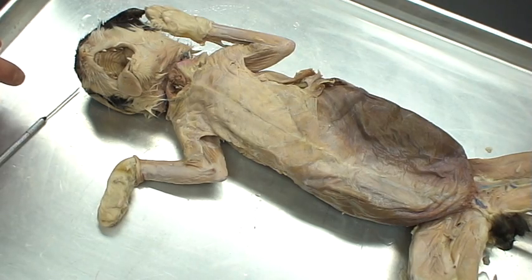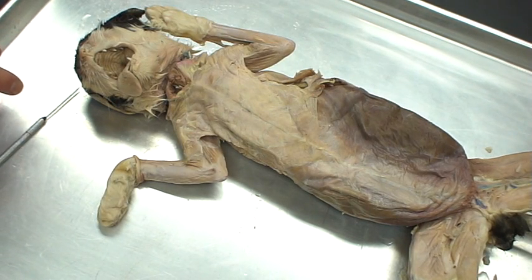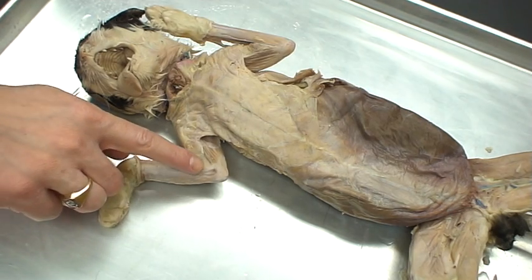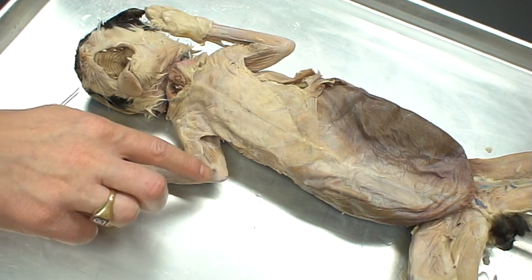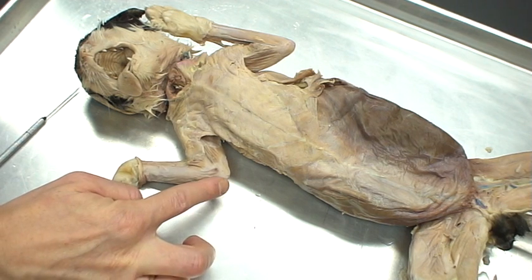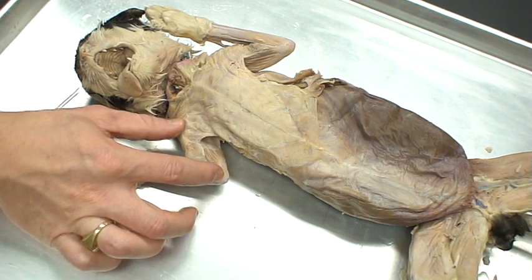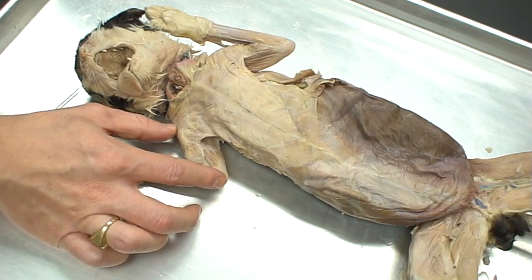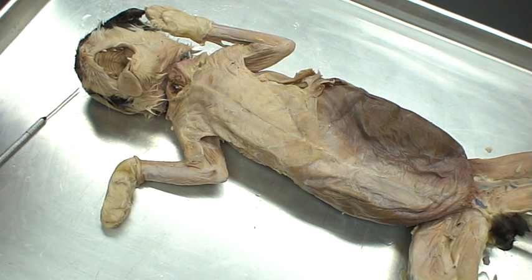There are better terms for that. We'll use cranial, meaning toward the head, and caudal, meaning toward the tail. When we talk about proximal versus distal, proximal means toward the attachment point to the body itself. So if we look at the radius and ulna here, this would be the proximal point and this would be the distal point. If we look at the humerus, up at the shoulder would be the proximal attachment and here would be the distal part of the humerus. All the bones are named this way and we'll use proximal and distal throughout the dissections.